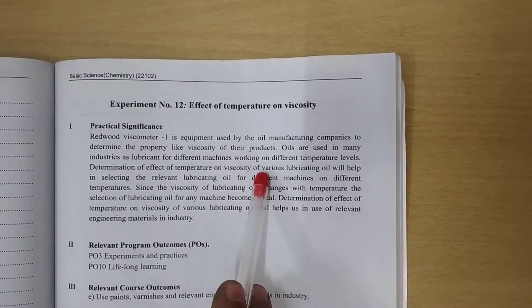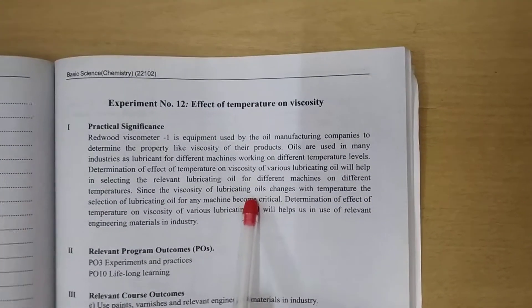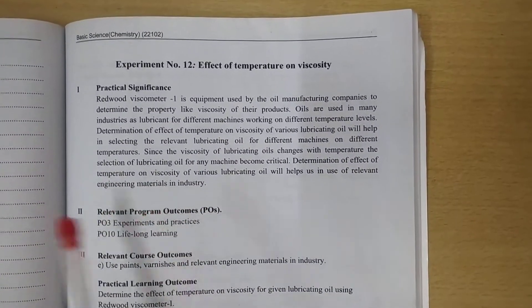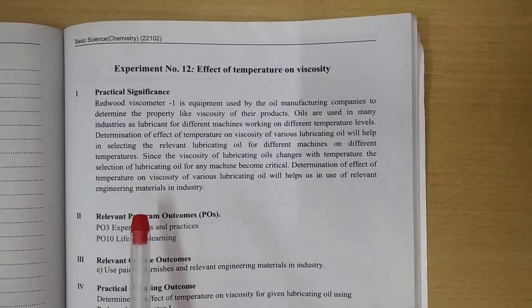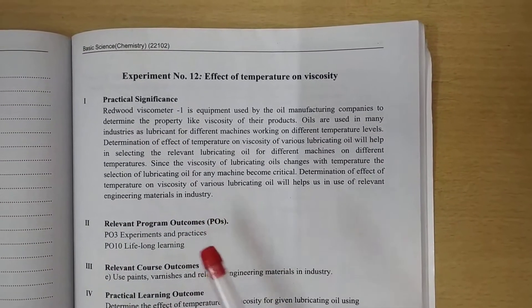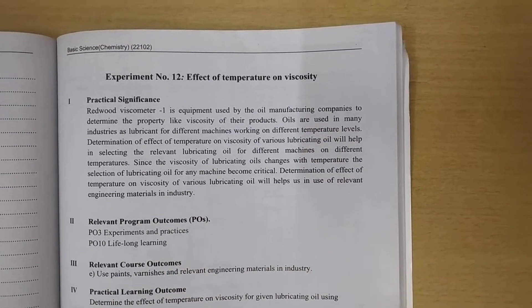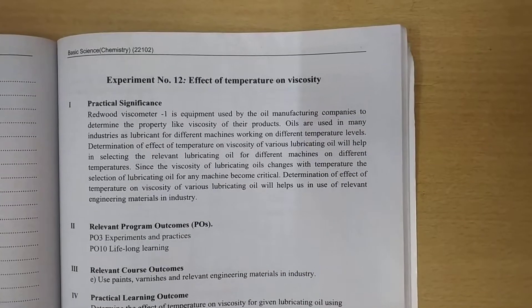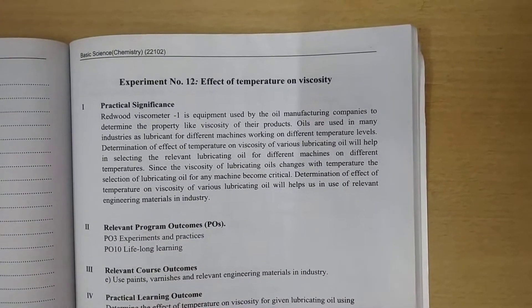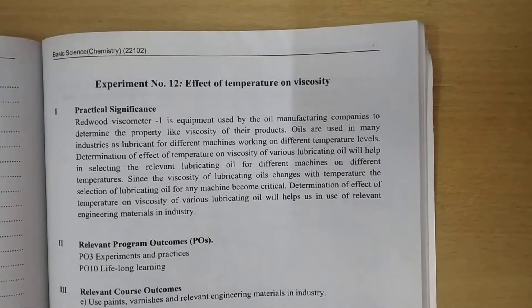Different types of lubricants are available in markets. But which lubricant oil is suitable for the engine or not? In industries, different types of equipment, instruments, machines, evaporators, desiccators, and crystallizers require different types of liquid oil. Which oil is suitable for the same equipment is studied by these experiments.